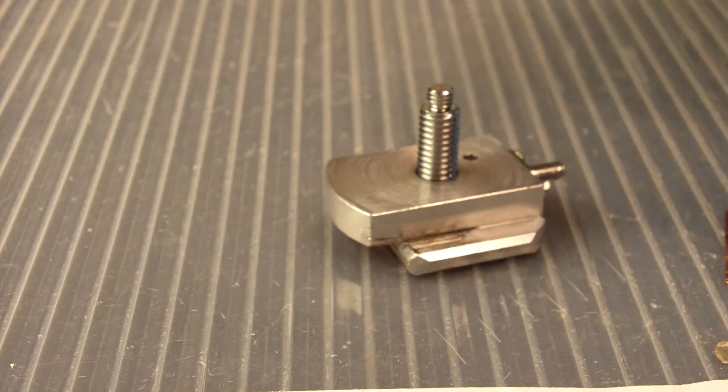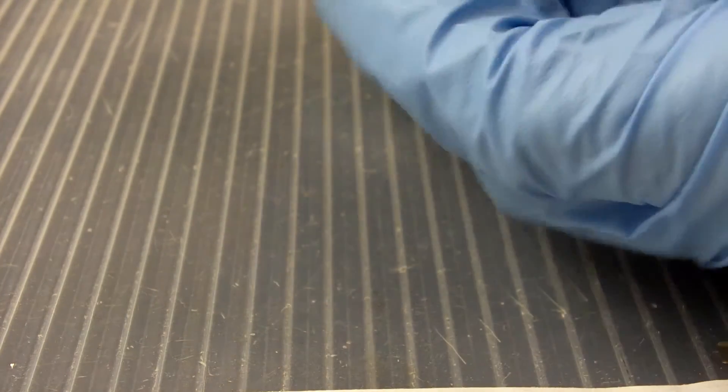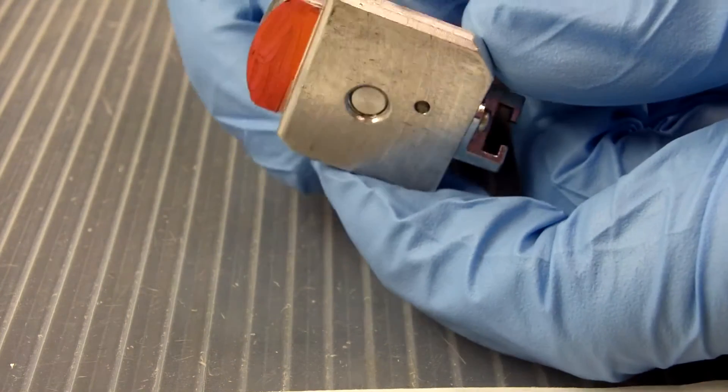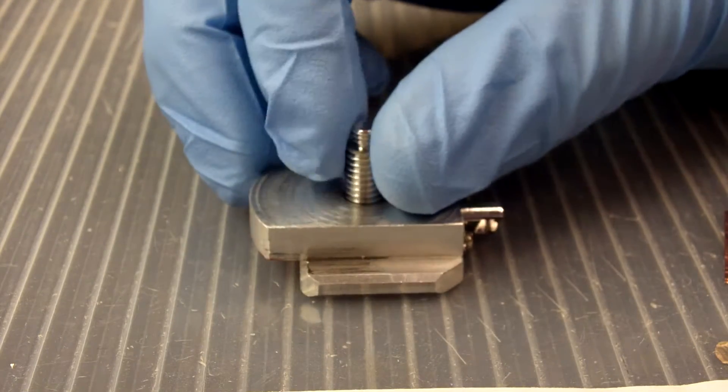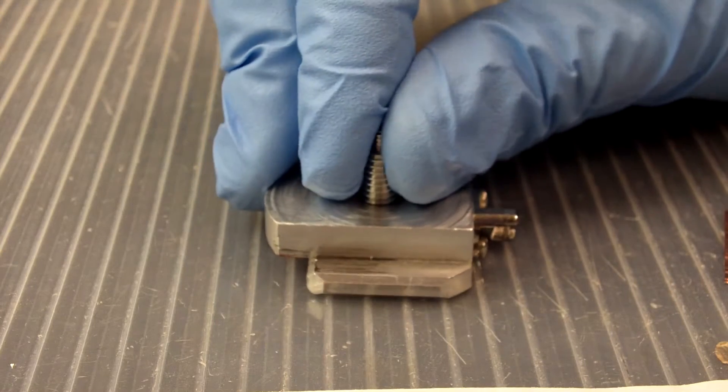So, back to the sample holder. This also means that the screw cannot go in too far to stick out the bottom. Just like that. So, this small change has solved two problems that people were having with the base before.